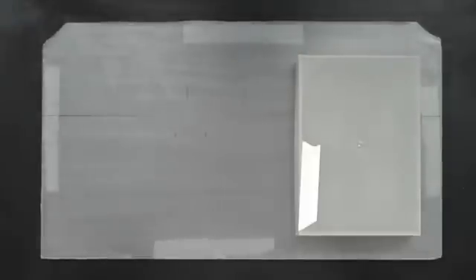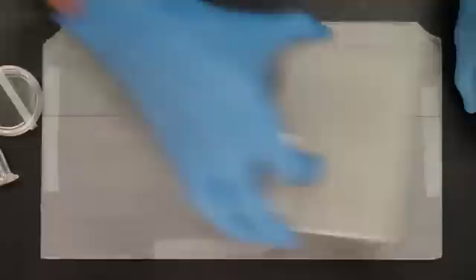You can cover the pads as they solidify to help reduce evaporation. After the pads have solidified, roughly 45 minutes, you can begin to create smaller pads for each of your experimental conditions.